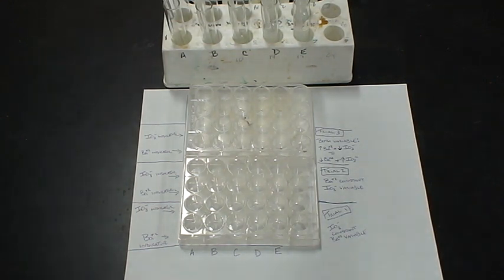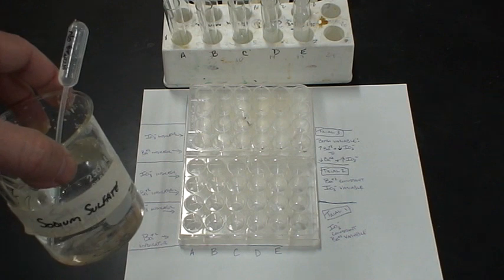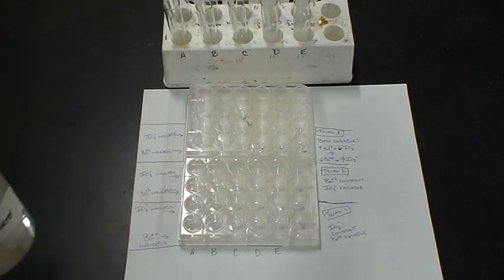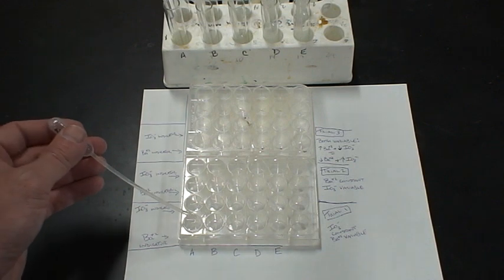Now the question is, do I have left over barium or do I have left over iodate? What we're going to use to figure out if it's left over barium is a solution of sodium sulfate. We're going to add three drops. This is my barium indicator.